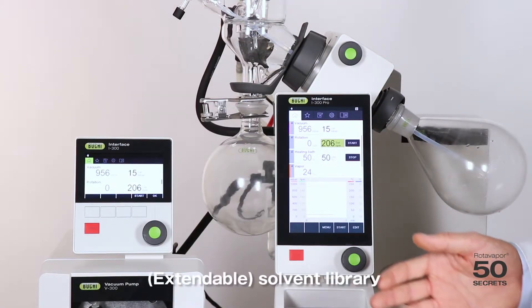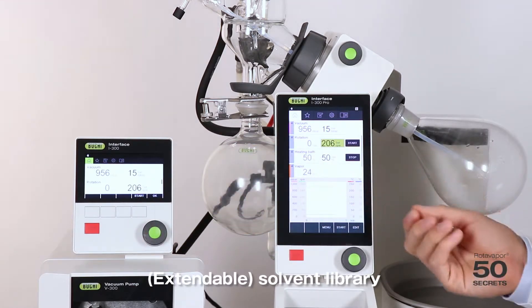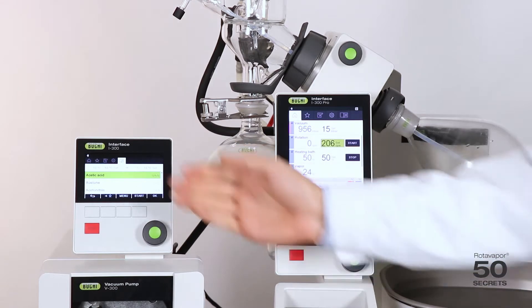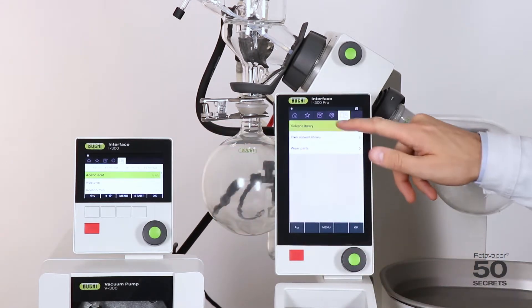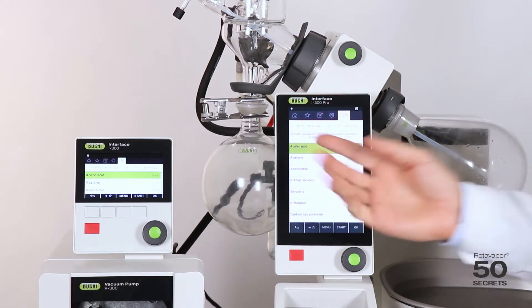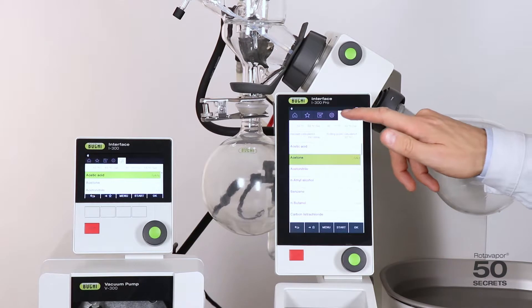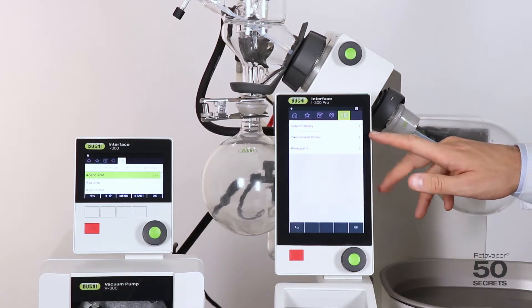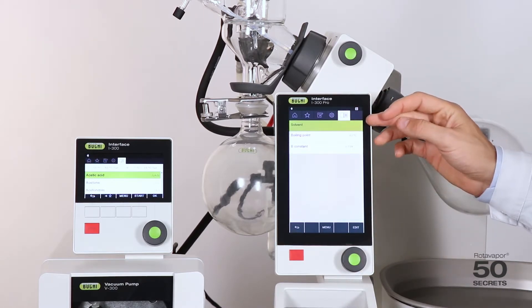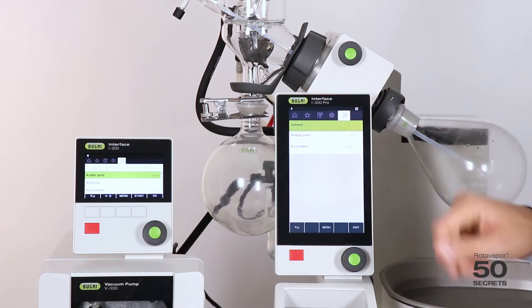The fourth difference is the solvent library. We do have a solvent library on the i300 as well as on the i300 Pro, but there are some differences. We have fixed programmed solvents on both, but on the i300 Pro you can see the calculated vacuum and the boiling point for the selected solvent. In addition, on the i300 Pro we have something called the own solvent library, so you can add your own solvent anytime — entering the solvent name, the boiling point, and the B constant. This solvent can also be added to the favorites menu.